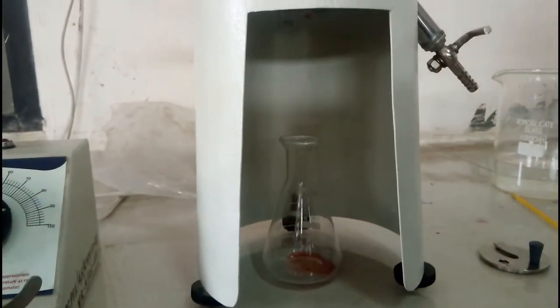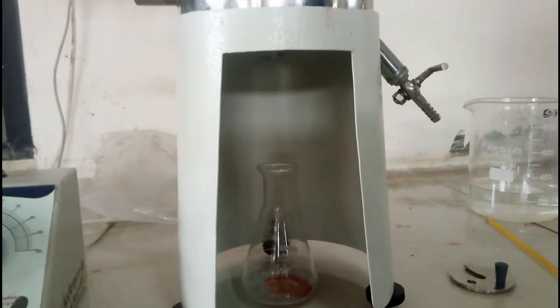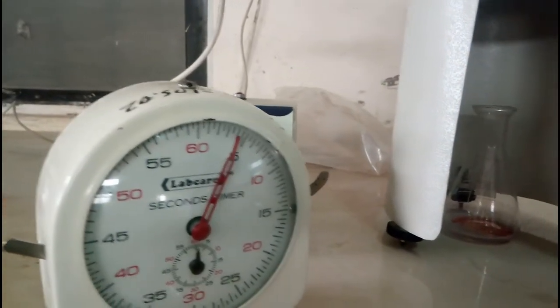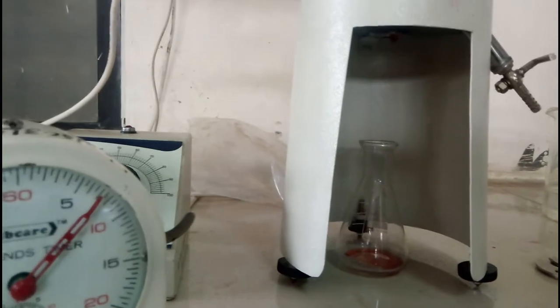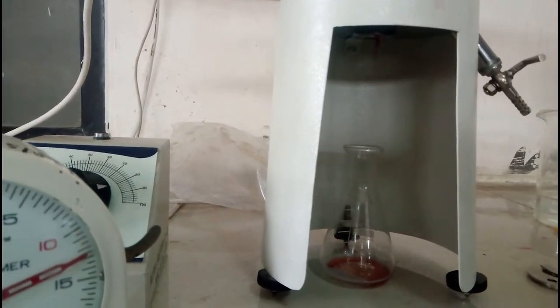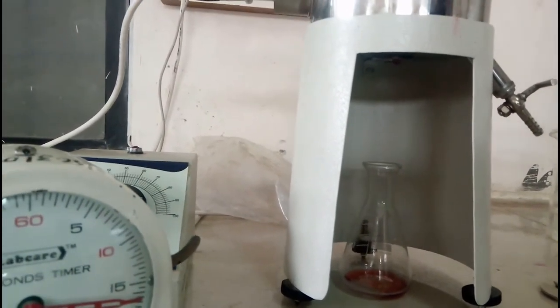When it was 35 degrees it was flowing slowly, but now as the temperature is increasing the flow rate is also increasing. We have to start the stopwatch simultaneously and record the flow rate — how much time it takes for 25 ml of lubricating oil to flow from that jet to the flask.